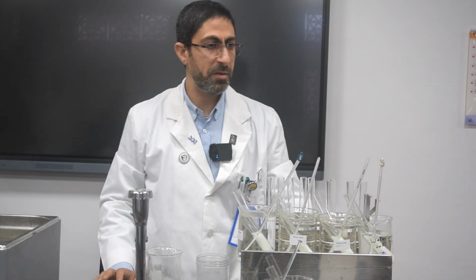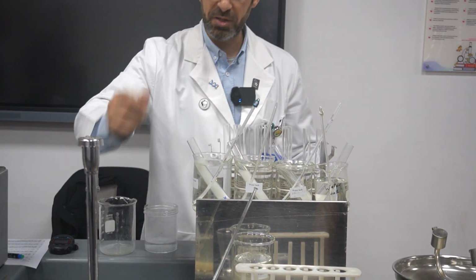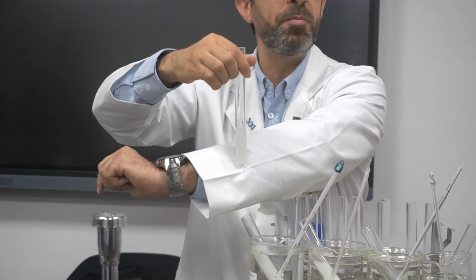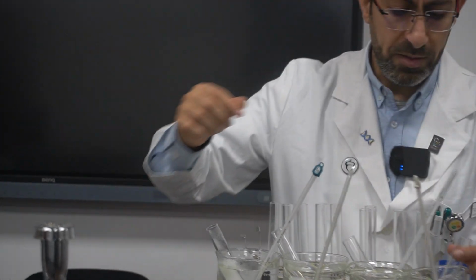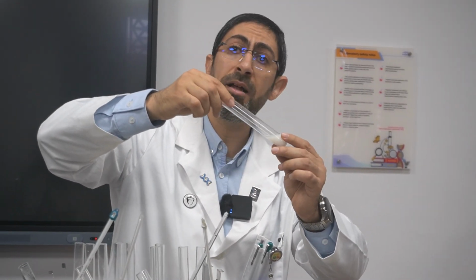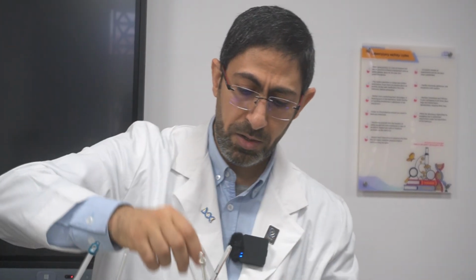Okay, thank you. Perfect. Here is the end point that we got in the water bath for the temperature 20, which is the room temperature. The reaction occurred, but actually it took about 19 minutes. It took a lot of time for the turbidity to be clearer. And if you have a look here at the water bath at temperature 30, we're going to find out that the chemical reaction occurred, but it takes less time. As we noted, it took about 14 minutes.